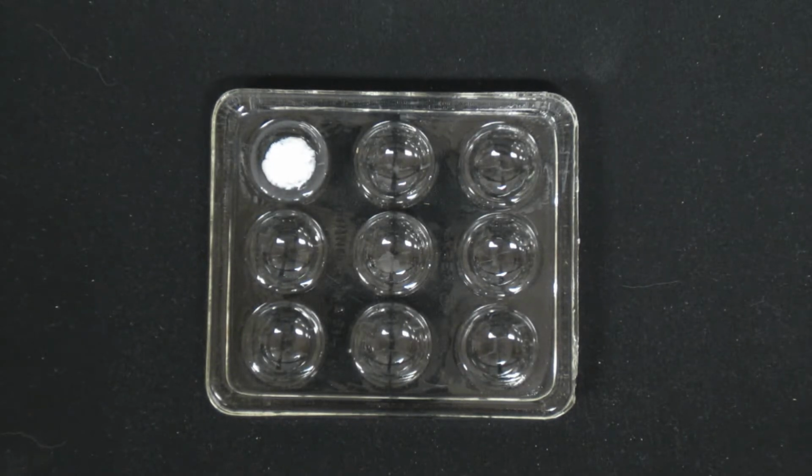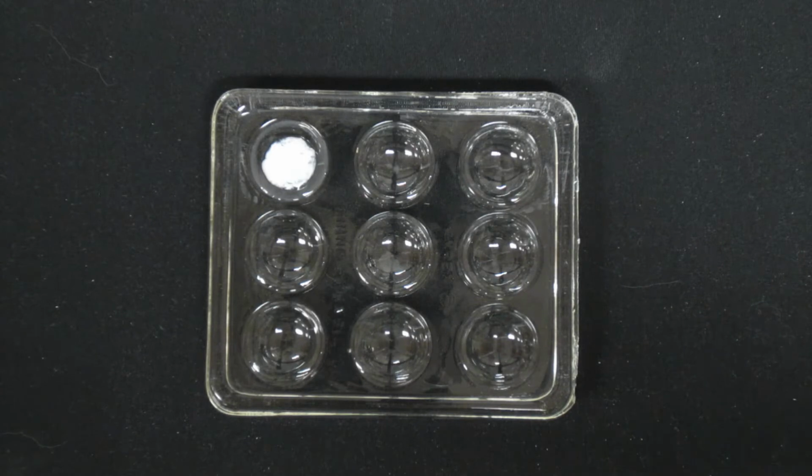So in the column marked observations, what you'll do is you'll just write down that a white solid forms there, okay? And then filling out the formulas for the insoluble salts and the equations, we'll worry about that later, okay? And that's actually addressed in one of the lecture videos for you.